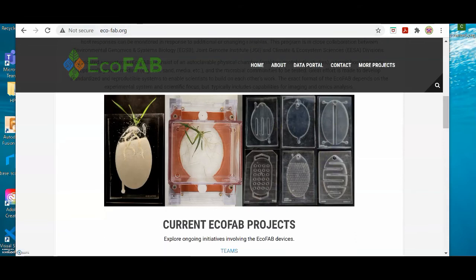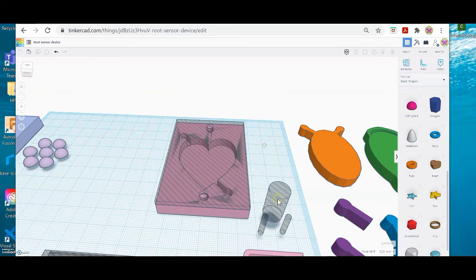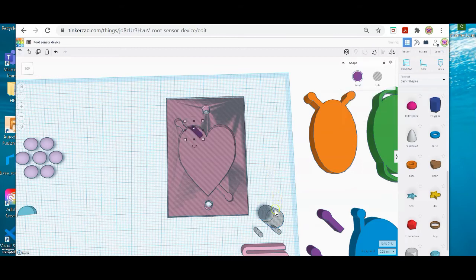So basically what we want to do is one larger hole for dropping the seed, and 2 holes for the ports. And you will find on your table here with your potato head pieces, these 2 smaller ones that can be used for ports, and then this bigger one for the seed. So I'm going to go ahead, I'm going to copy it. I'll copy this one. You can also do Control D and duplicate it that way.